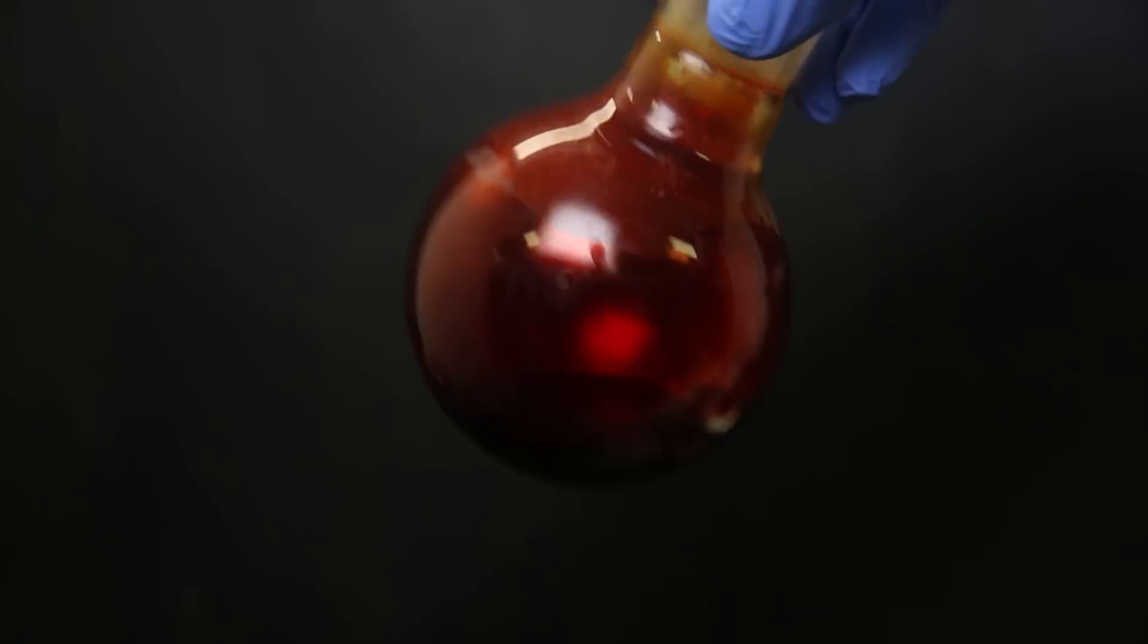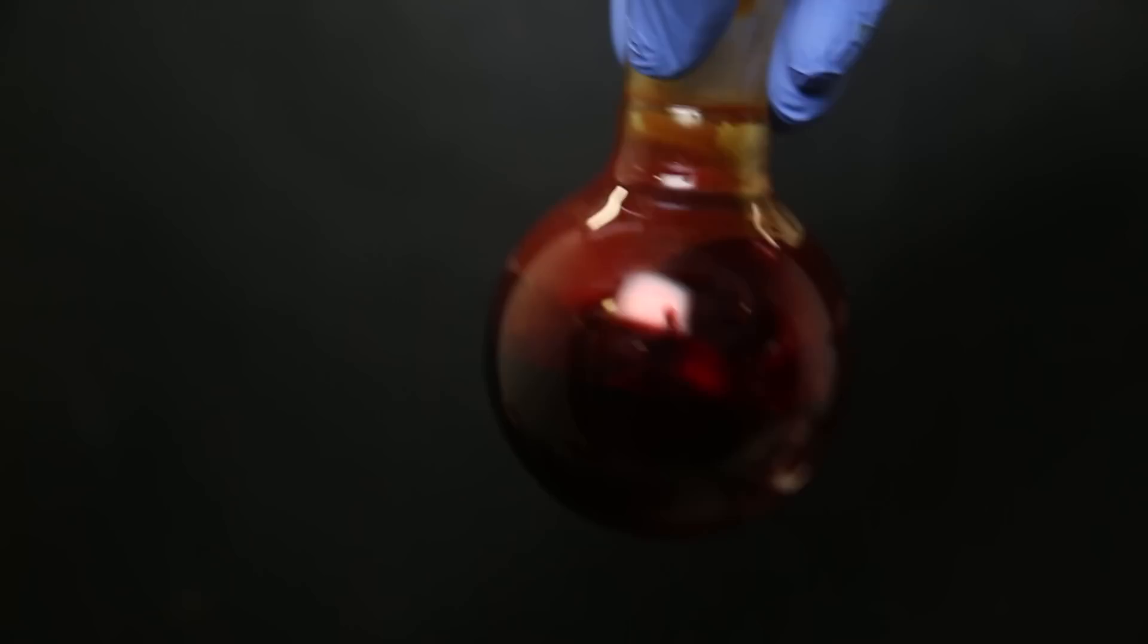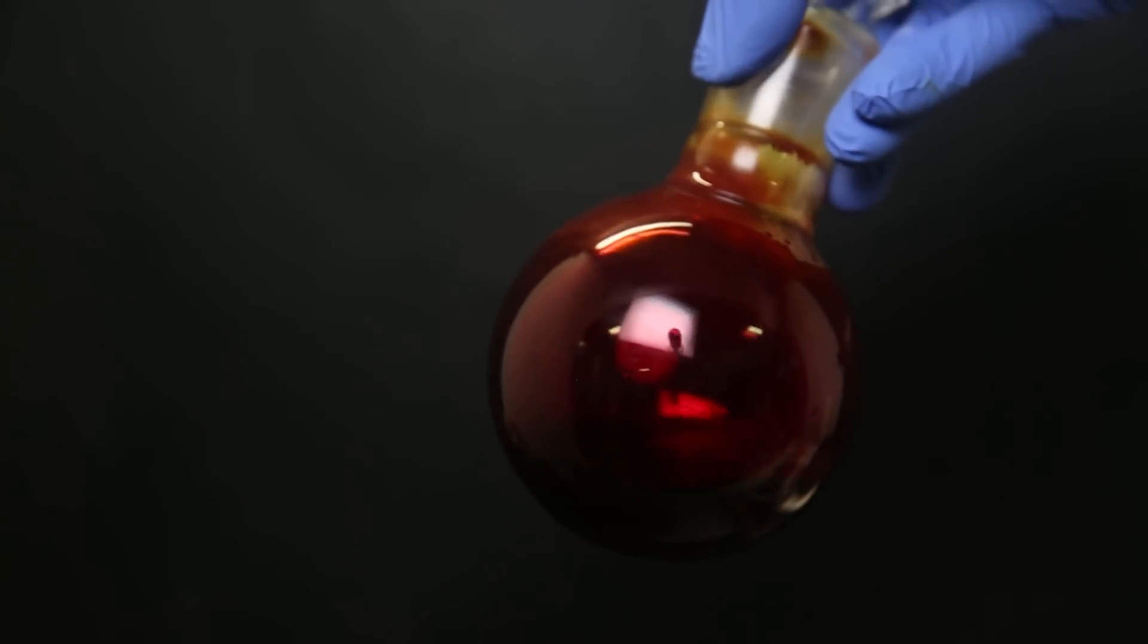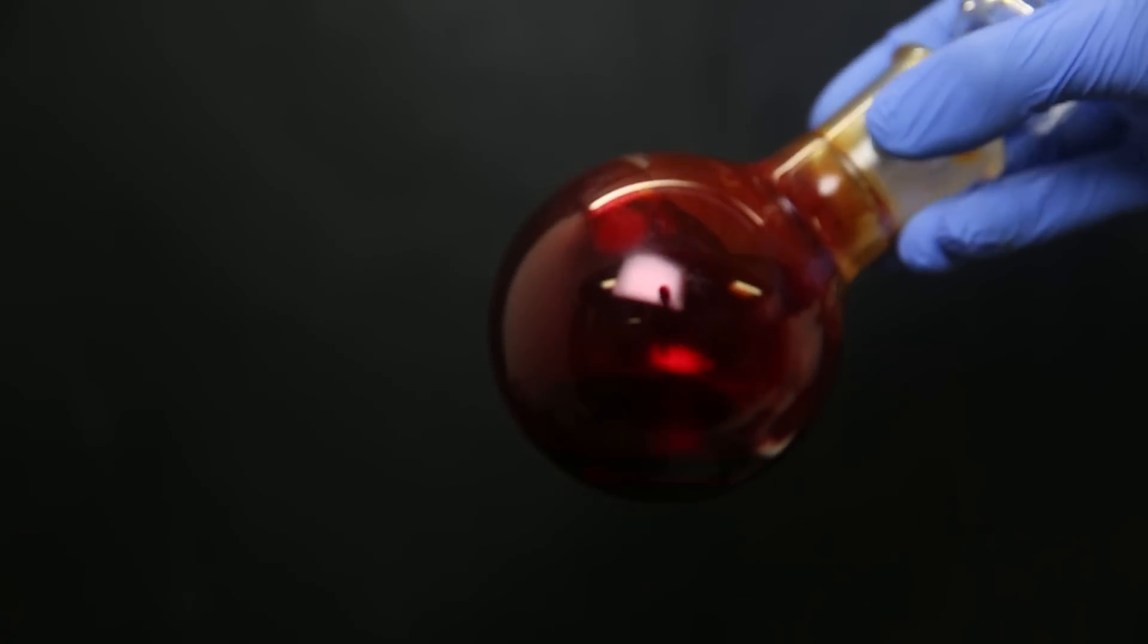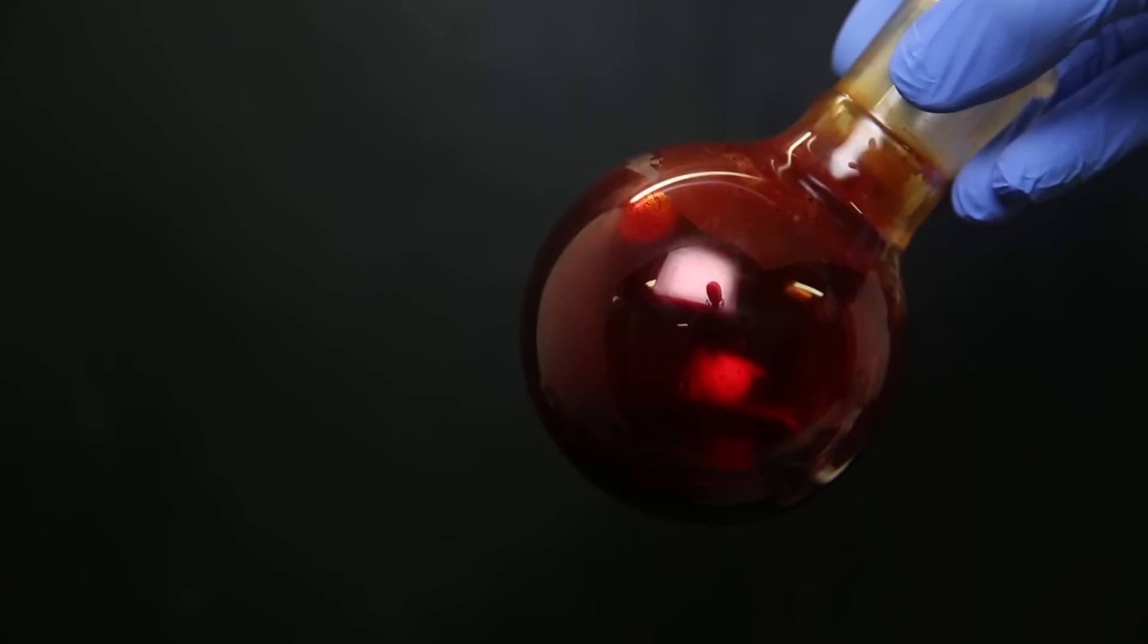In his video, he had some black chunks in his product, which he filtered out. I see some very tiny specks that are stuck to the glass, but it's not really significant, so I won't bother filtering it, and it doesn't matter for the next reaction.